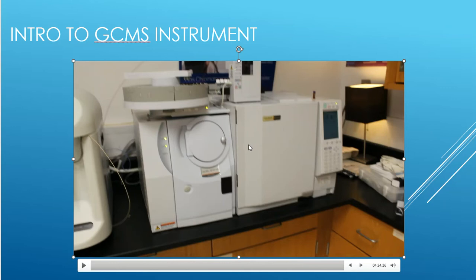So we do a little bit of basics, general chemistry, organic chemistry is typically required of the program. So you've already started the program, you just don't know. But we also focus more on the instrumentation pieces and parts and how they work and how to replace those and how to maintenance those and make sure that the data actually looks pretty good. So just a little bit about our GCMS system that we have in-house.